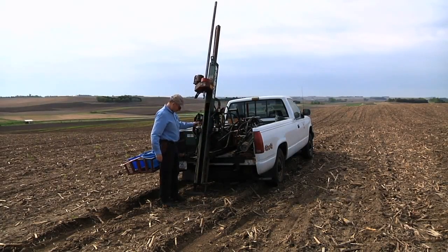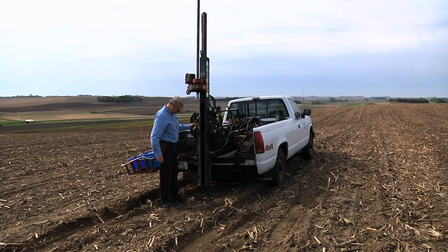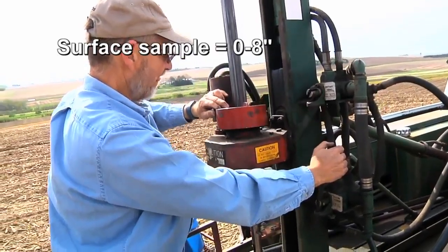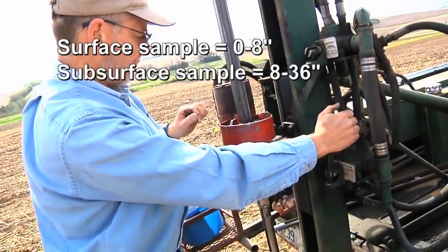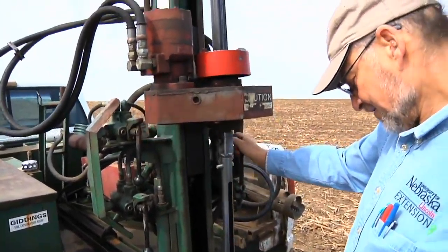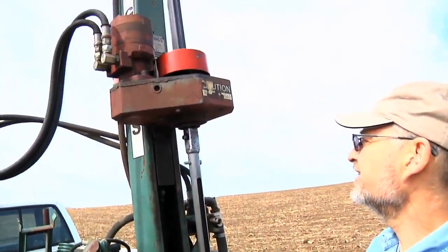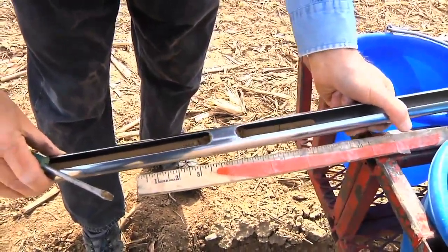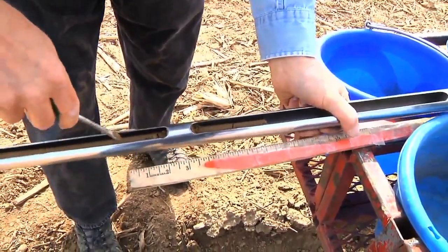Subsurface samples should be continuous to the bottom of the core. For example, with a surface sample of 0 to 8 inches, collect the subsurface sample from 8 to 36 inches. However, information about the vertical distribution of nitrate-nitrogen in the field can be obtained if the subsample is broken into segments such as 8 to 20 or 20 to 36 inches.